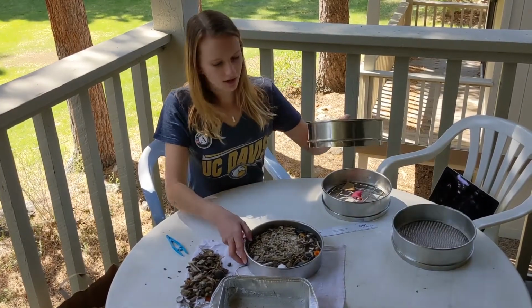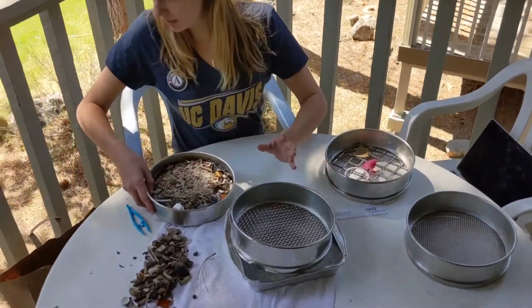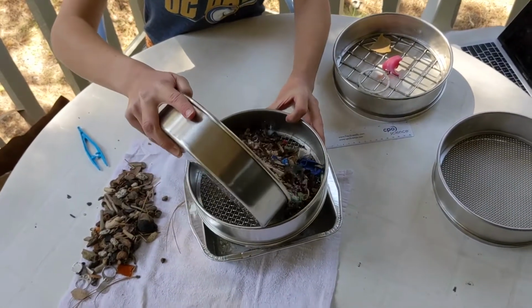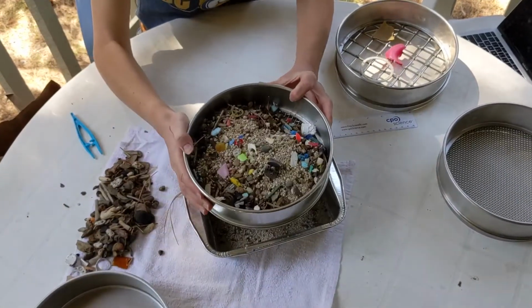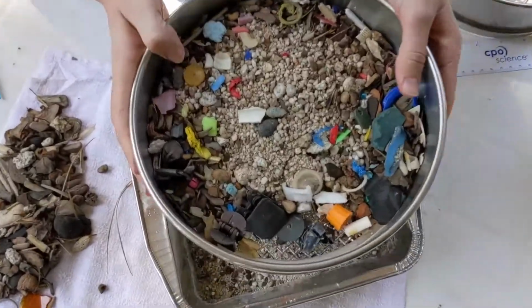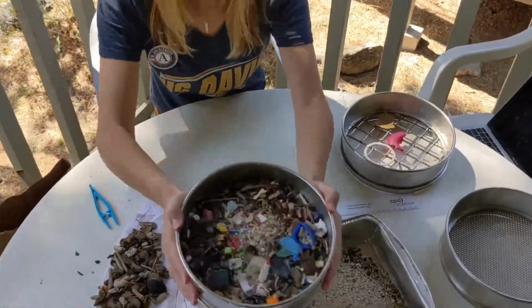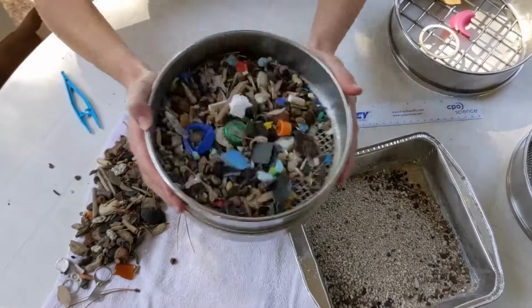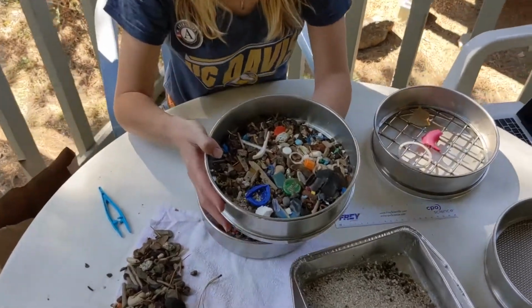So to do that, we are just going to pour our plastics through the sieve once again. And we only have one base with us right now, so it's going to be a little tricky. We're going to improvise and then shake through to catch anything, and I'm going to put the base back on so that way we can get really vigorous. Once you've done that, everything on top should be a mesoplastic.